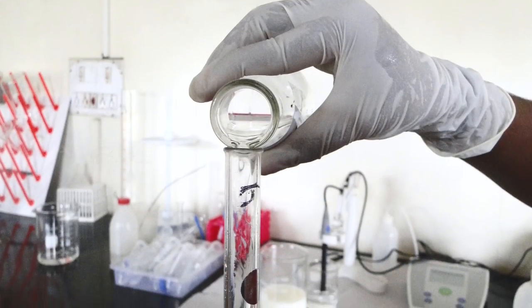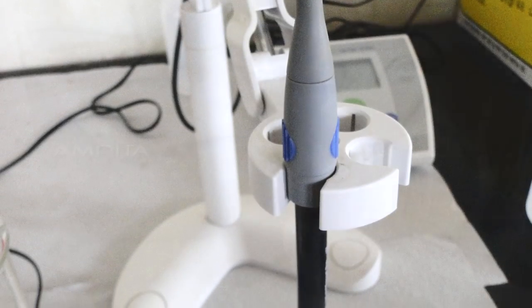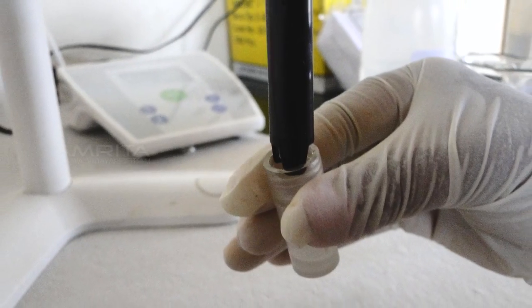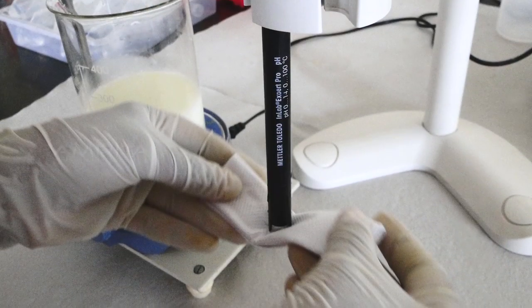Take 0.2 normal HCl and pour it into the burette. Now remove the electrode of the pH meter from the KCl solution. Wash the electrode using distilled water as shown. Wipe the electrode using tissue paper.